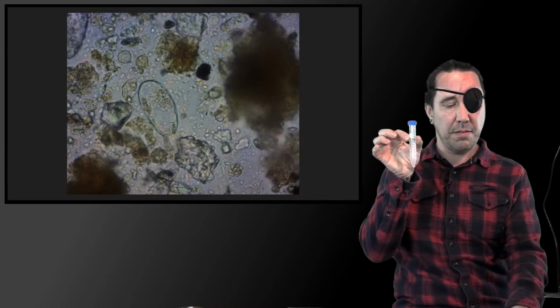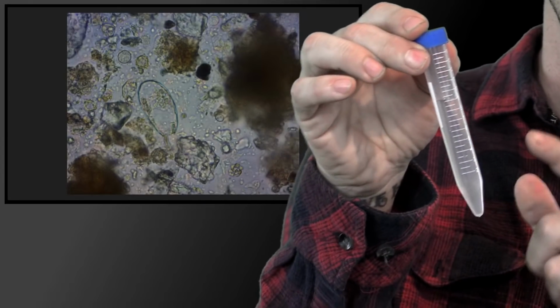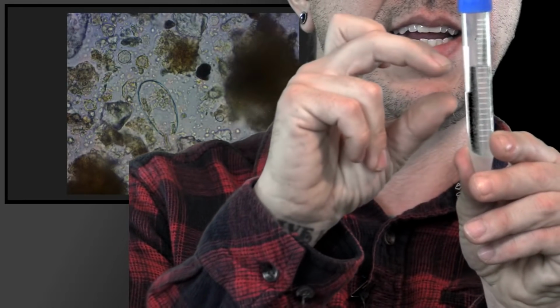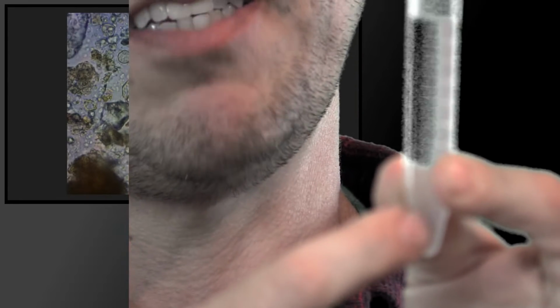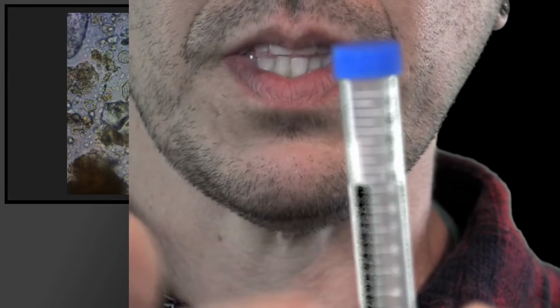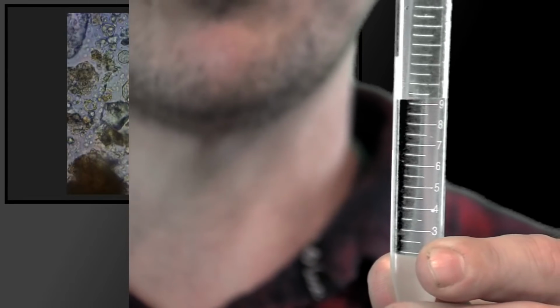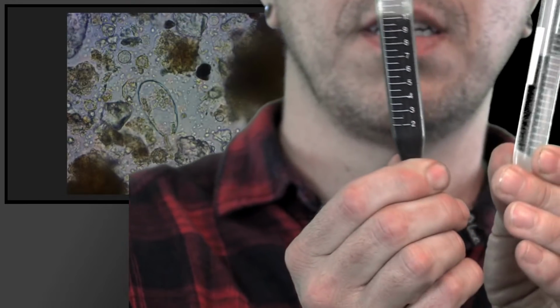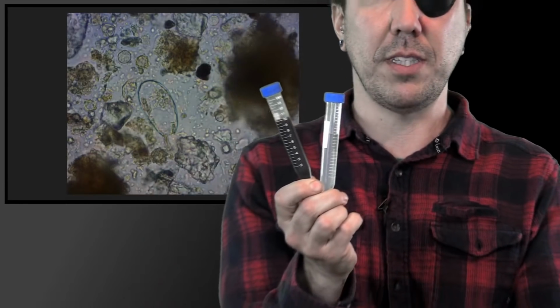So these are 15 milliliter centrifuge tubes, and I like to fill them up with water first. If you're putting your solids in there first and trying to get an even 1 gram or 1 milliliter of material, you're going to have air pockets. So I like to fill it up. We're going to do a 1 to 10 dilution. So you want to have 9 parts water and 1 part of your solid like compost or soil. I've got that one filled up to 9, and then I put 1 part of, this is worm compost I believe, so it's filled up to 10 now. And then I've got other ones filled up here to 9 parts.